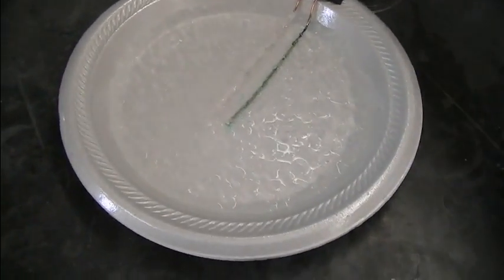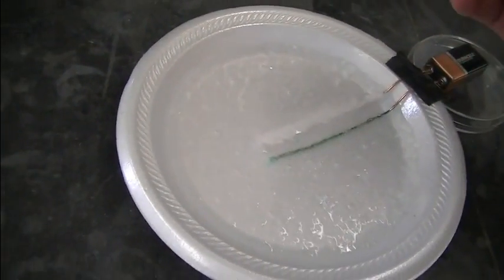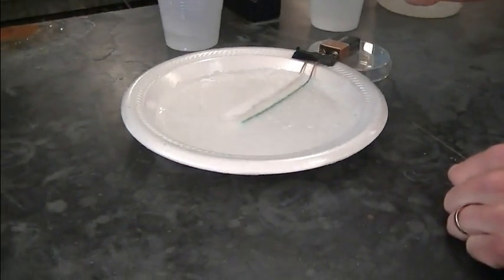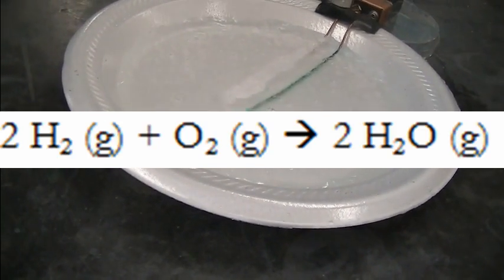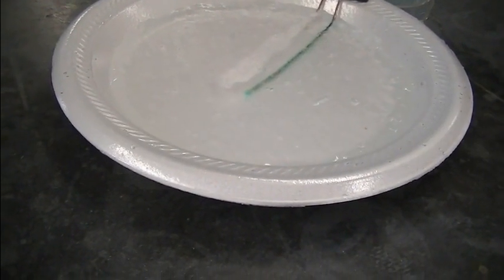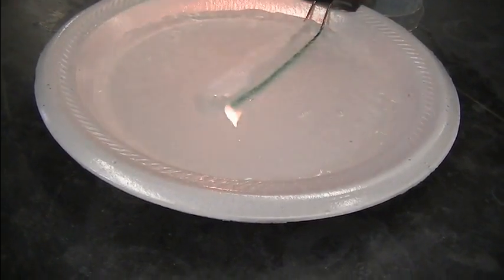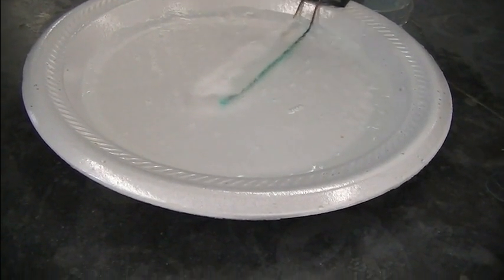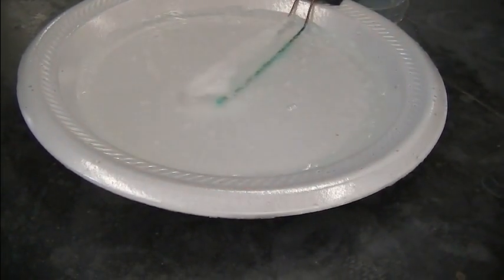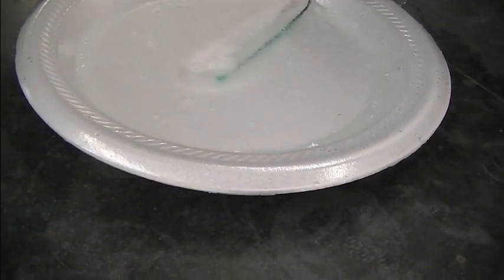I'm actually just trying to get a bunch of bubbles to be produced over here on this side. Boy, I can really see those bubbles turning on now. Those bubbles are hydrogen gas. And what's fun is if I can get those bubbles to grow big enough, like maybe some of them over here are, you know those bubbles are full of hydrogen gas. And hydrogen gas reacts with oxygen gas. And there's oxygen gas in the atmosphere. So it's not happening now because the hydrogen gas isn't warm enough. But if we get it warm enough here, you might be able to hear a tiny explosion as the hydrogen gas reacts with oxygen gas in the air to form water. Let's try this here. Hear that little pop? That's a tiny explosion. That's the hydrogen gas that's being produced reacting with oxygen gas in the air to form water. So that's sort of a chemical test of the identity of the gas that's being produced over here.